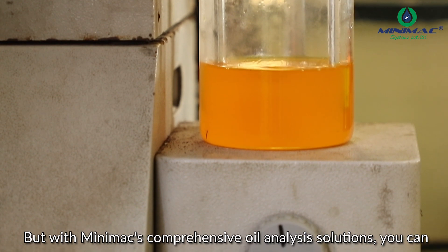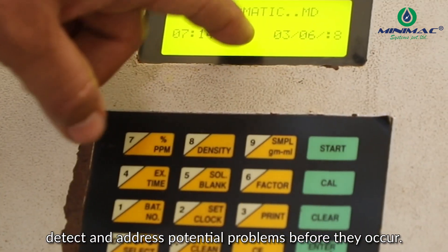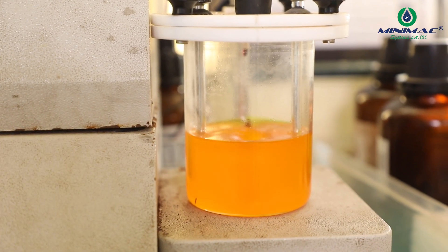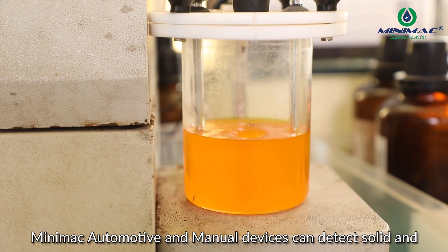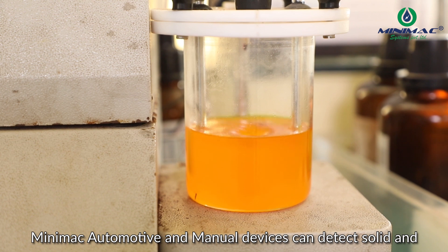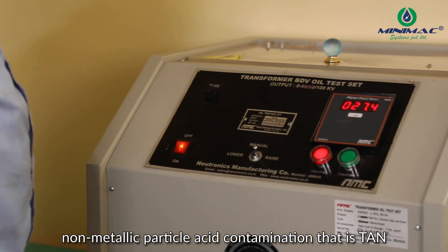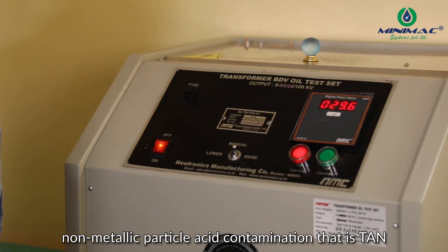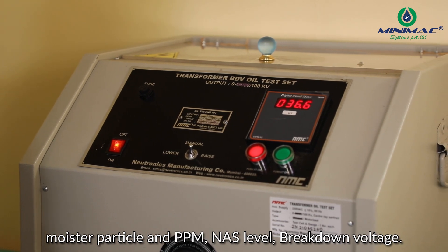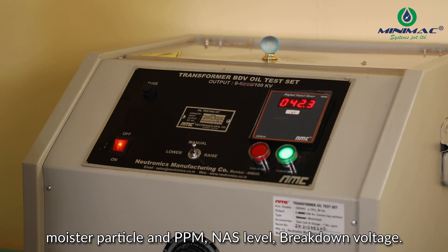But with Minimac's comprehensive oil analysis solutions, you can detect and address potential problems before they occur. Minimac automatic and manual devices can detect solid and moisture contamination like solid metallic and non-metallic particles, acid contamination (TAN), moisture in PPM, NAS level, and breakdown voltage.